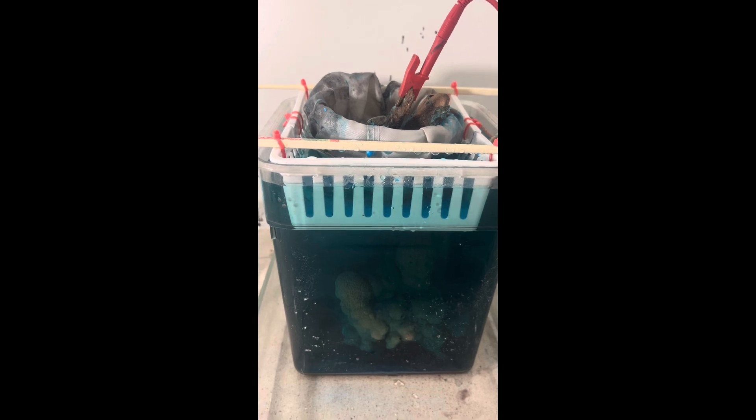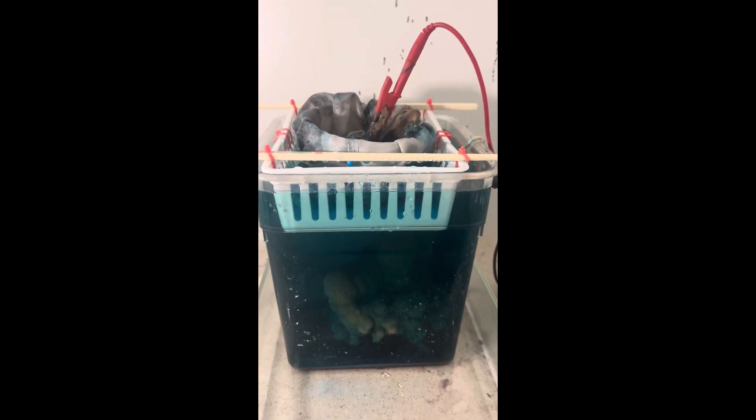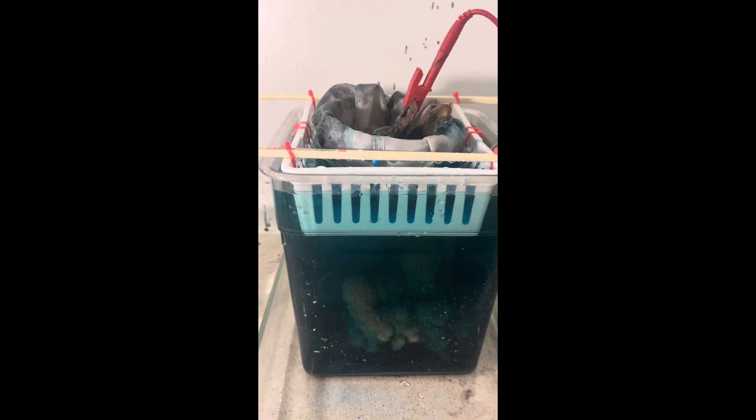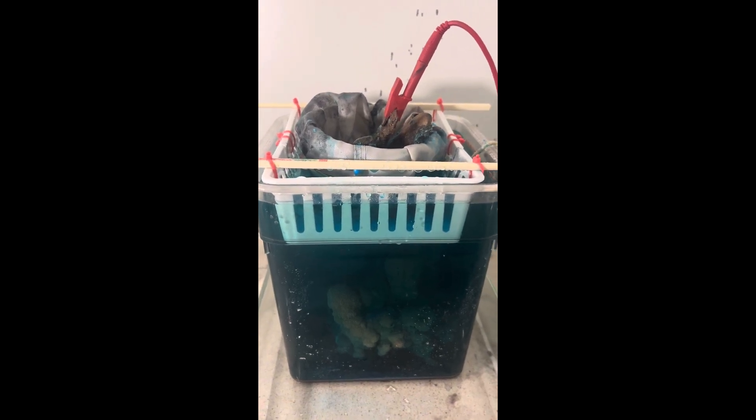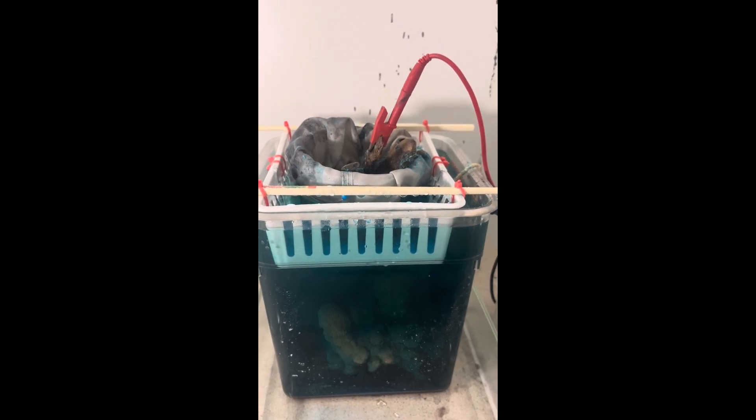I'm running now at about 3.2 amps, so I'm pretty happy with the conductivity. I usually have to add a little bit of sulfuric acid into the system to work on the efficiency and conductivity — I find it works better. Anyway, that's it, and I will show you what I'm doing with those silver fuses, but I have to cut away and put that in some denatured alcohol real quick.